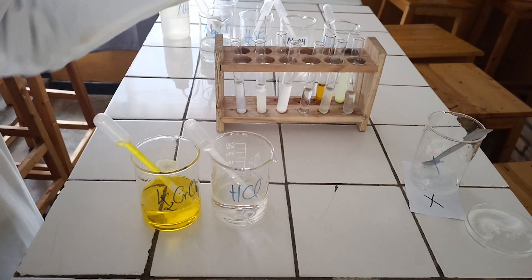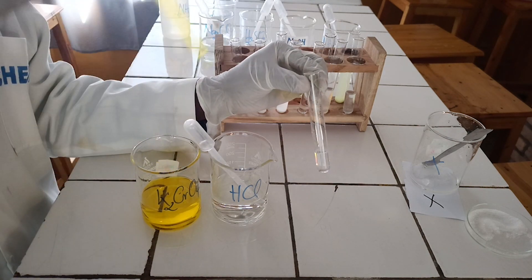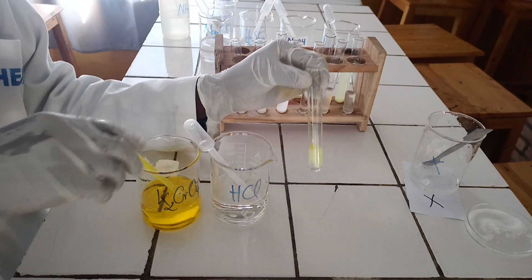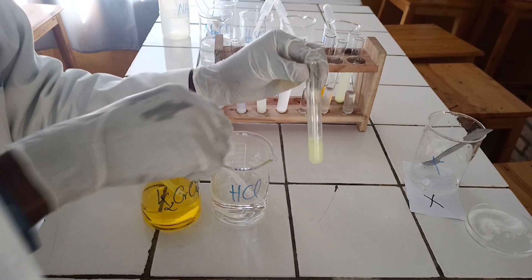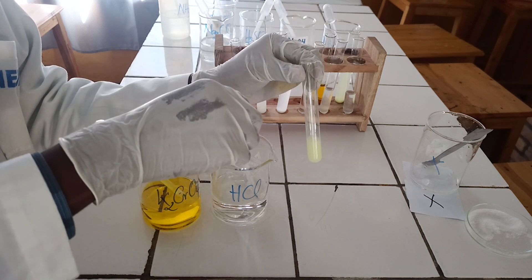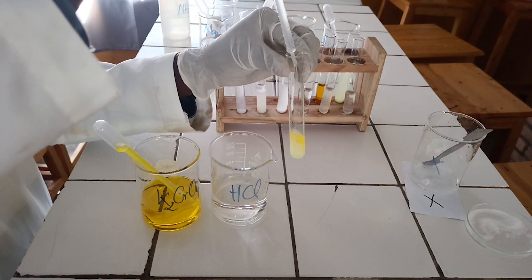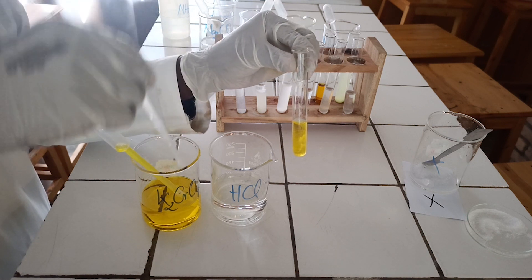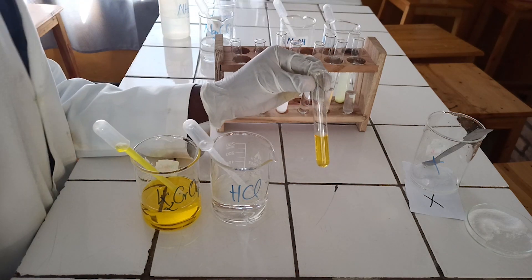Third confirmatory test. To the eighth test tube, add a few drops of potassium chromate solution followed by diluted hydrochloric acid, and then add diluted sulfuric acid. As you see, potassium chromate reacts with barium ion to form a yellow precipitate, which is soluble in hydrochloric acid, and the precipitate reappears on addition of sulfuric acid.